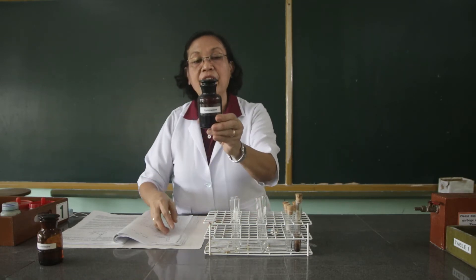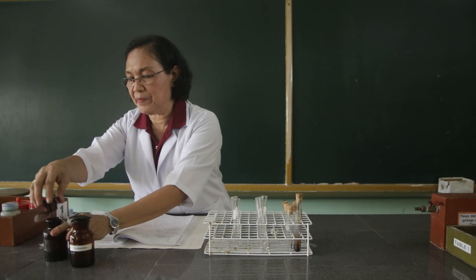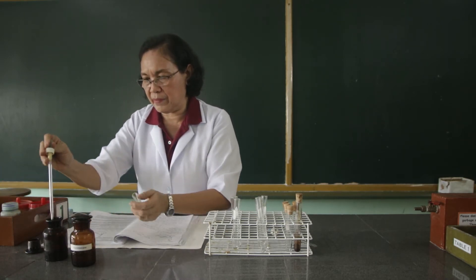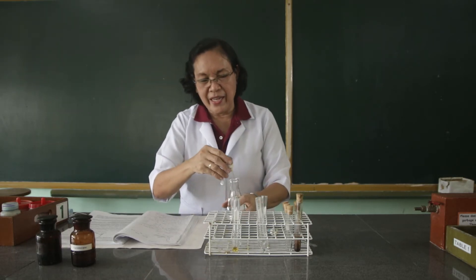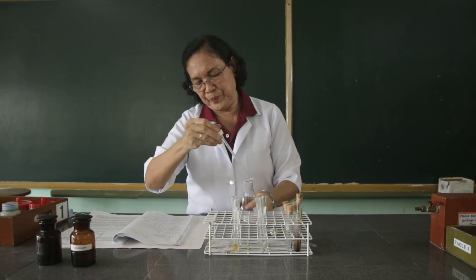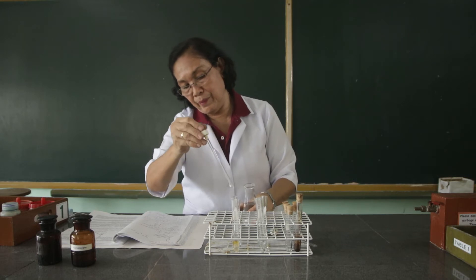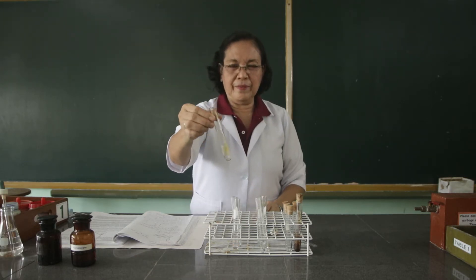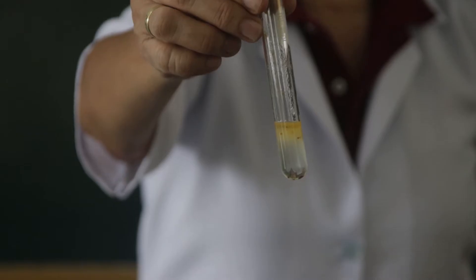Let's have the cyclohexene. This is the cyclohexene. We are going to use also six drops of the cyclohexene, then add 3 ml of water. Let's mix it to see whether it is soluble in water. Observe what happens.